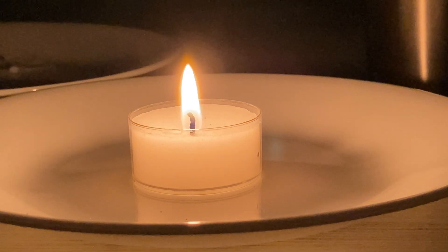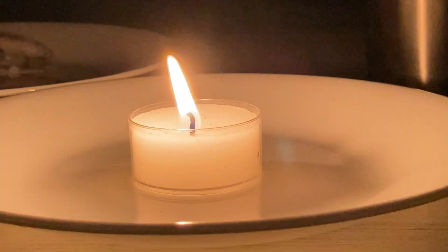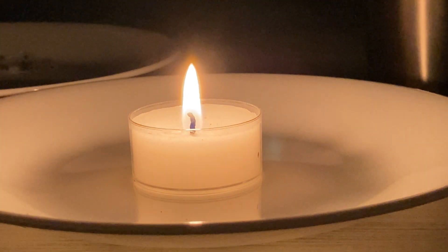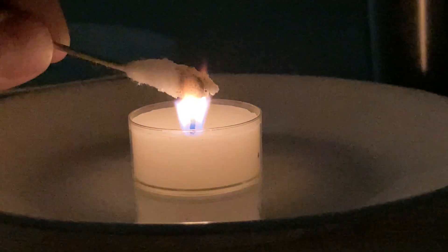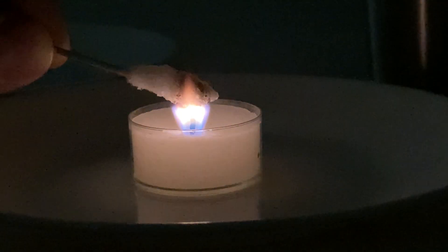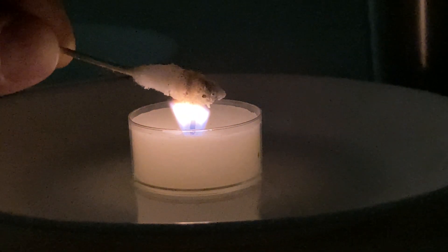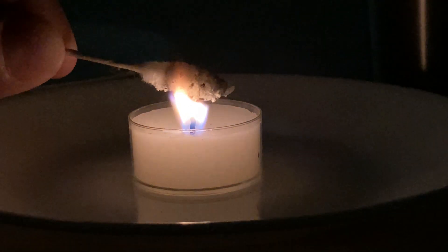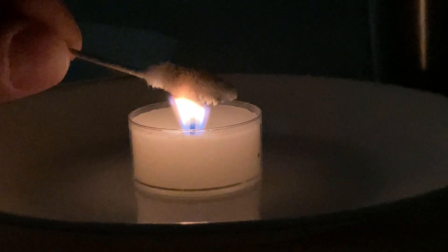I'll dirty my water a bit here — this isn't exactly clean procedure. I'm going to get the swab wet again and pick up more of the salt substitute so I can maybe see the lilac a little better. Completely cover it up — there's definitely some lilac starting to come out, especially right underneath the q-tip. I wish you could see it better, but you can see the lilac coming out.